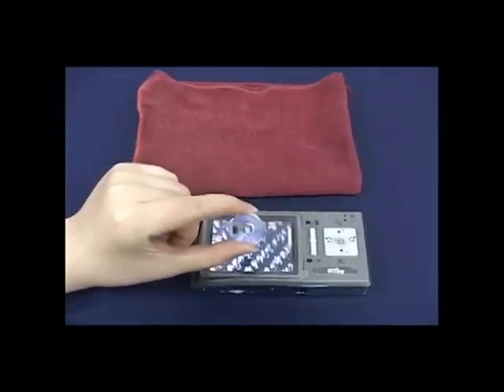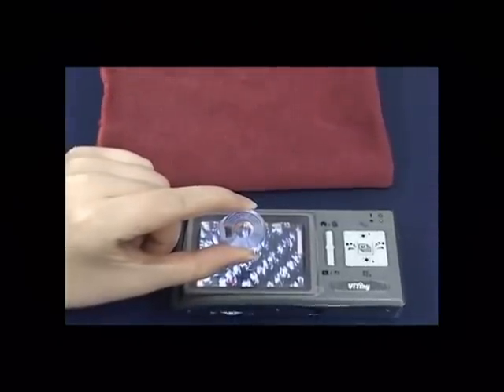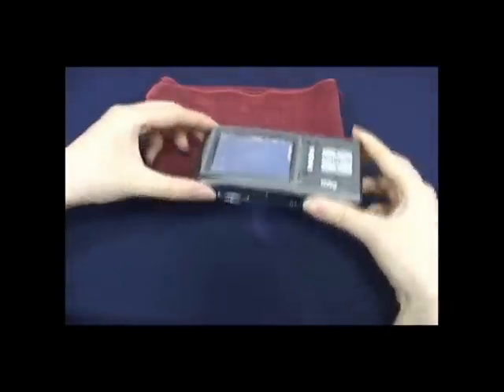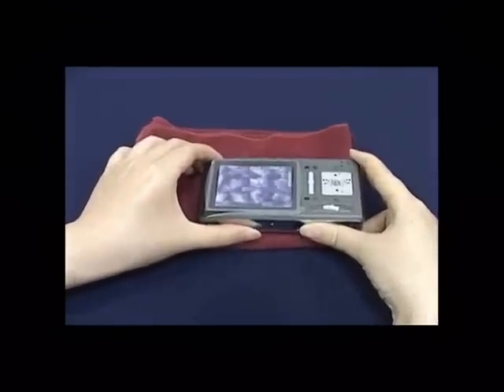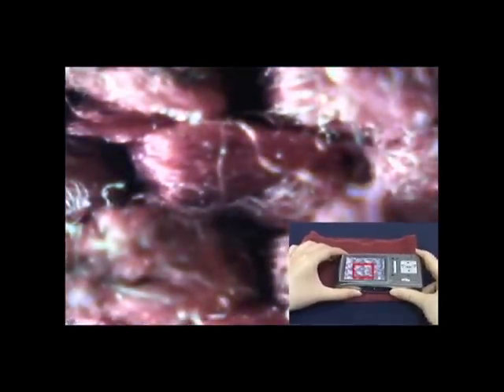Place the shallow contact cap onto the machine. The shallow contact cap has magnifying capability and can attach to the screen. It is used to observe soft materials like cloth, wool, paper, hair, skin, etc. Adjust focus and lighting to start observation.